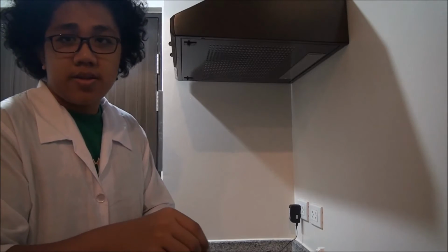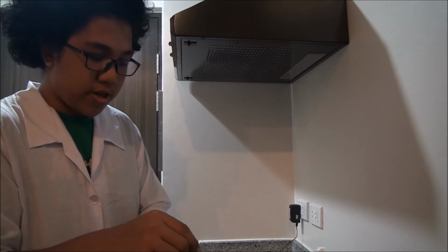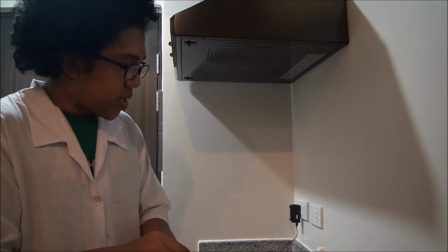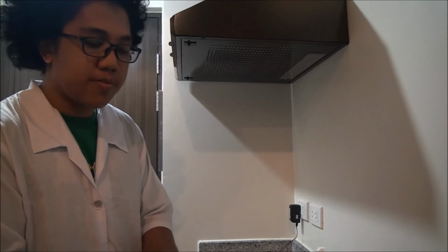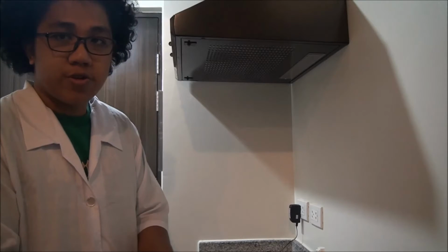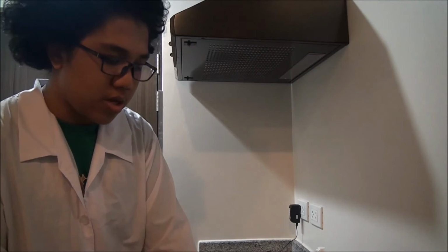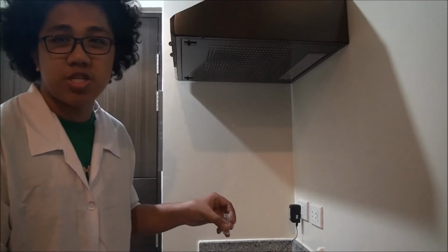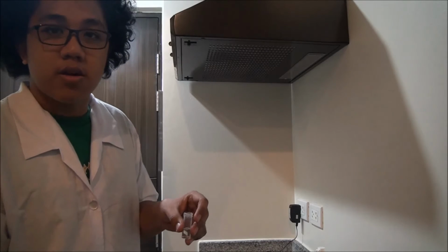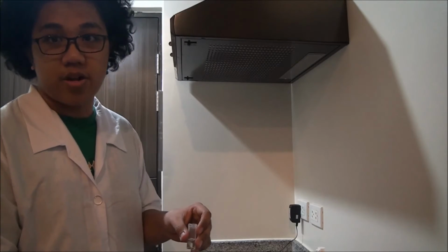So that's it, guys. That's the pH sensor, how we use our electronic pH sensor. But now for storing tips, if you bought one of these, they probably gave you some storing solution in little bottles, but I already ran out of that. So I advise you use distilled water for storing solution and change it every month, or depending on you, every 2 weeks, but just don't extend beyond a month.